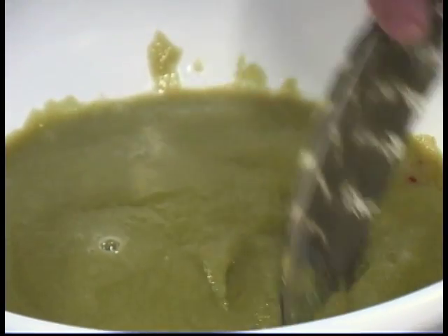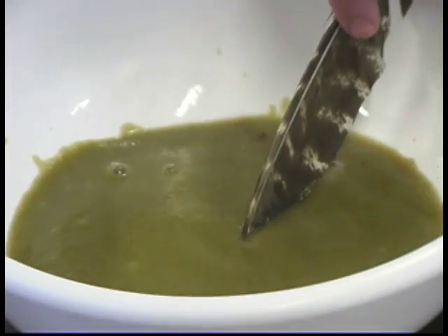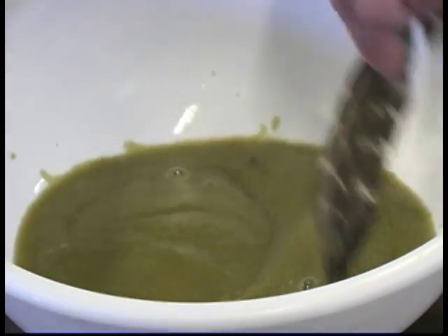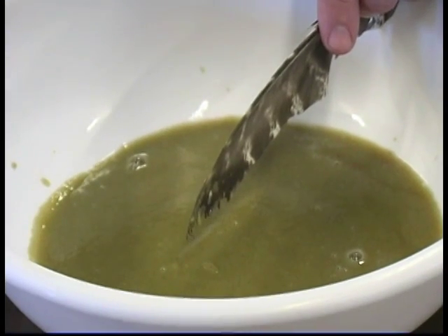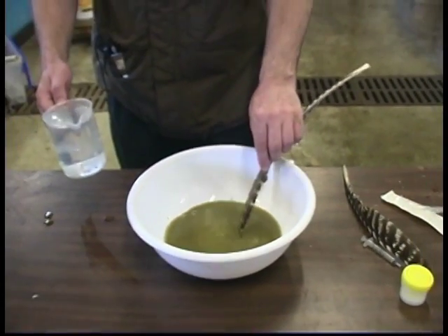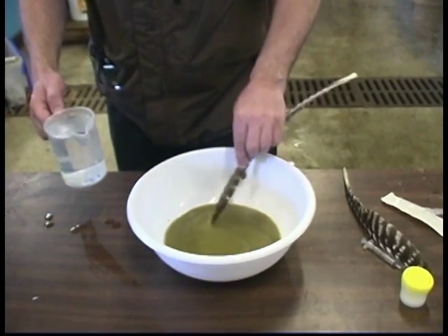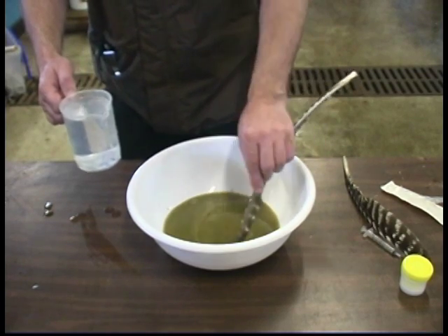As explained in the lecture, currently nothing has happened yet, because eggs are not activated without water, and sperm is not activated without water. This is simply mechanical mixing. Now we add water. From the beginning, it's better to use water first, and only after that add milk solution to prevent clumping and adhesiveness. Now there will be actual activation of eggs and sperm.